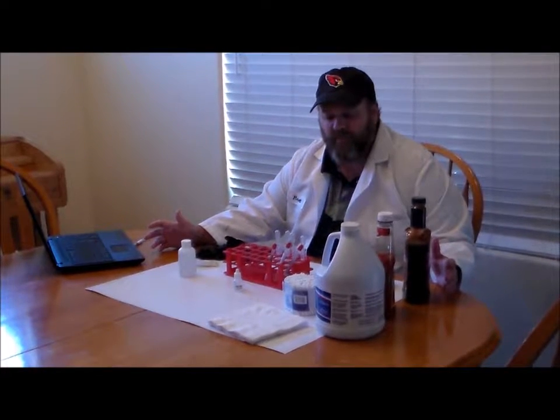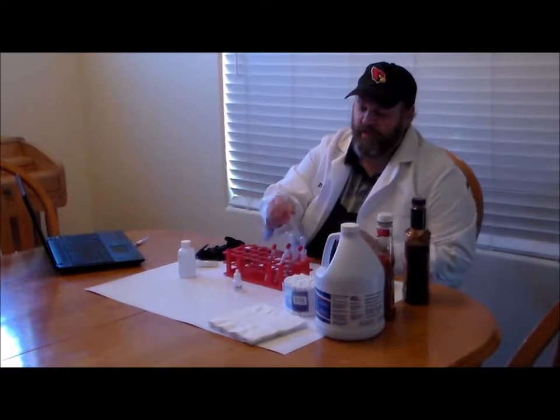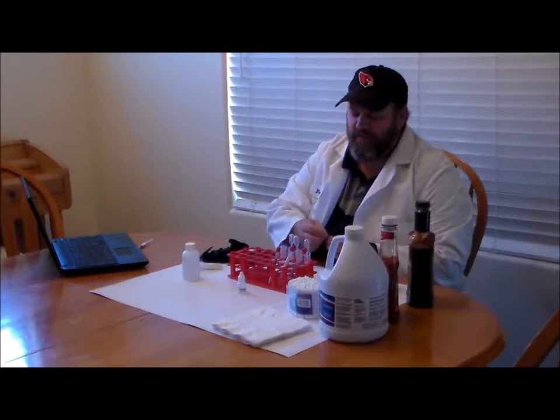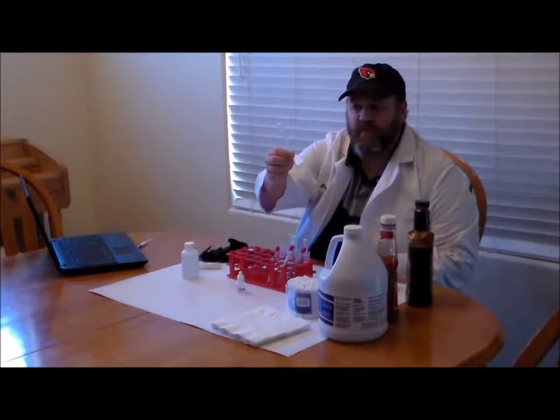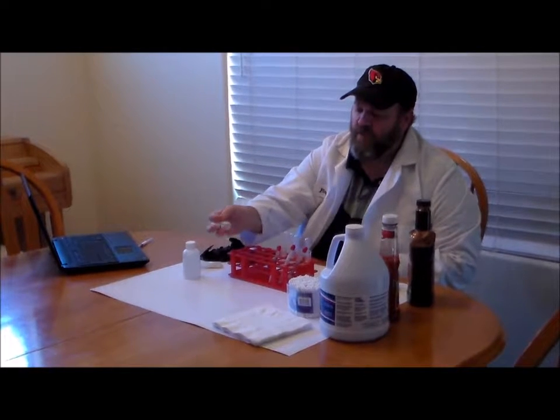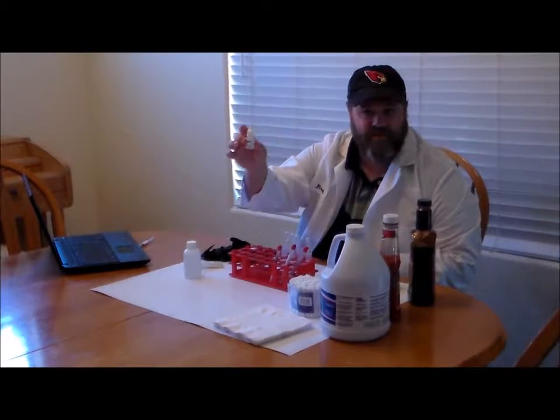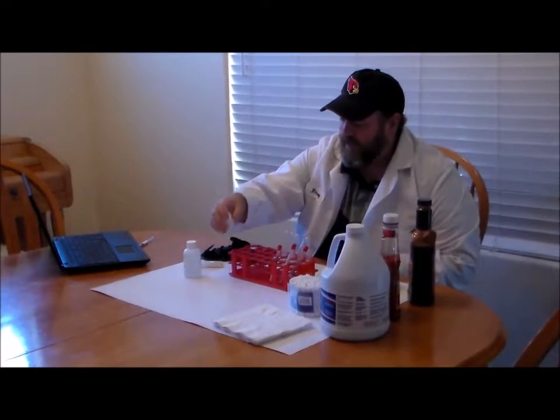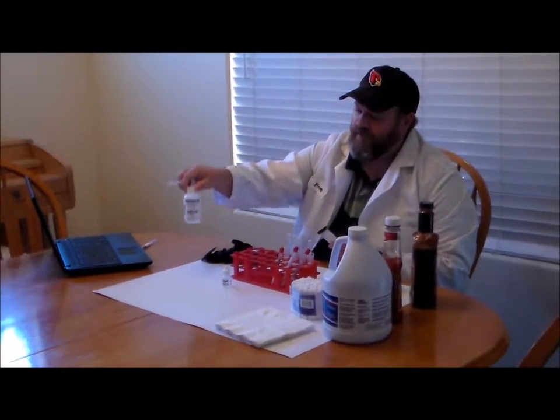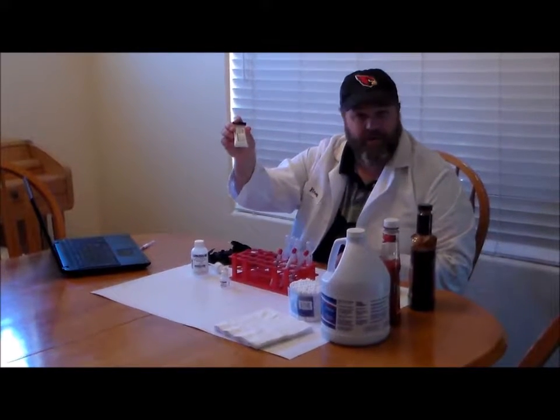The things you're going to need from your home lab kit include at least four plastic disposable test tubes, at least four small plastic disposable transfer pipettes, a small bottle or vial labeled ethyl alcohol, and a luminol kit, which has a small bottle with a sprayer and some powder to mix in.